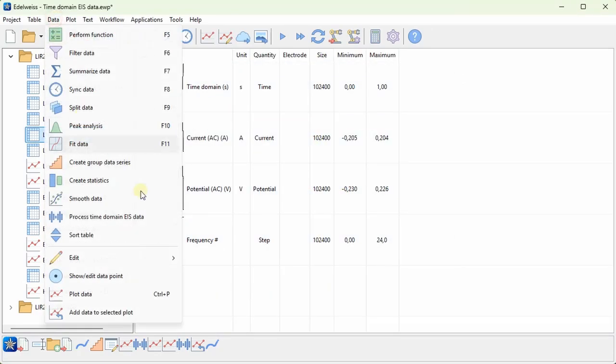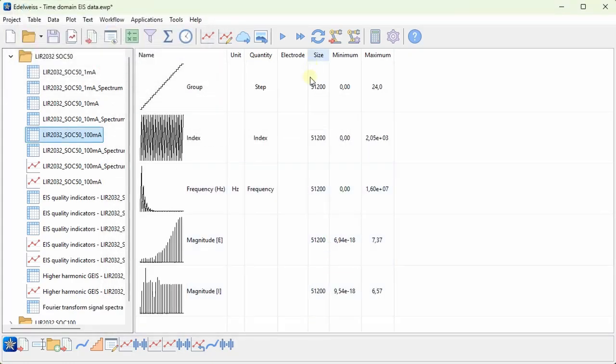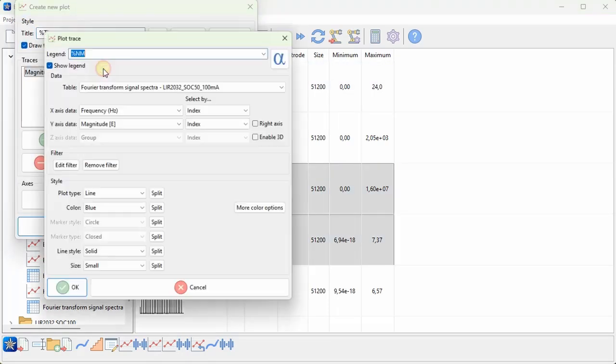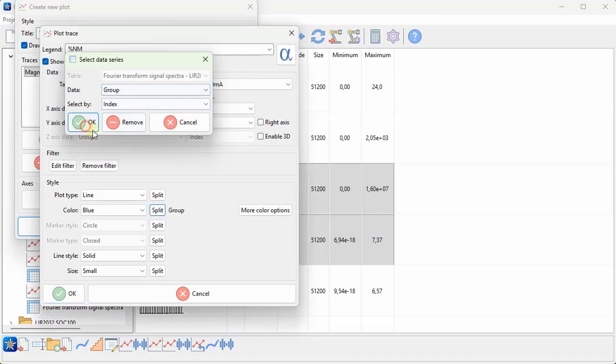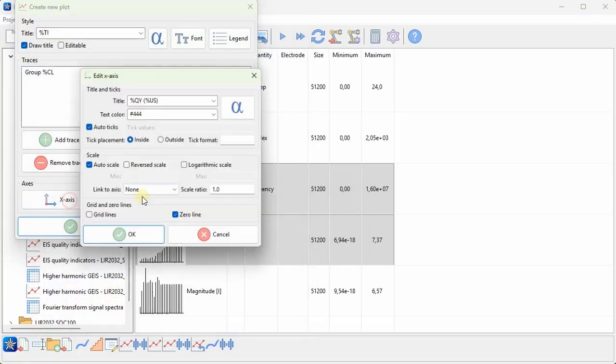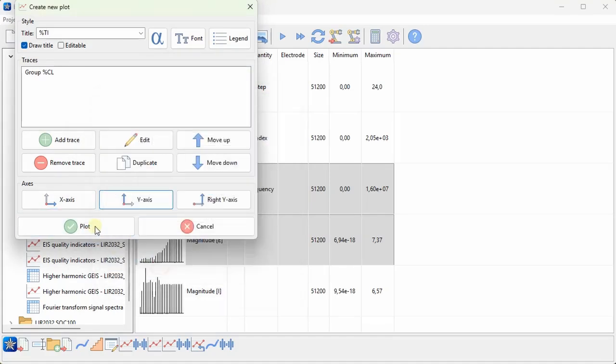Next up, we can also look at the raw Fourier transforms of the current and potential data series by selecting Calculate Fourier Transform Spectra. And here we get the Fourier transform of both the potential and current with frequency for each group. So perhaps we plot the potential Fourier transform, and I will split it based on the group. Maybe just label it from the group, and I will do it on a log-log scale. So choose logarithmic for both x and y.